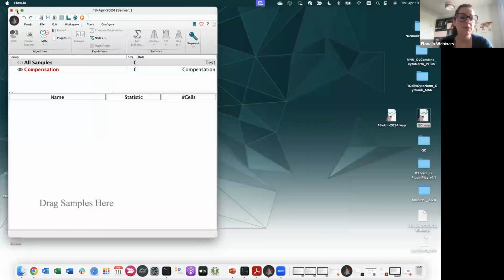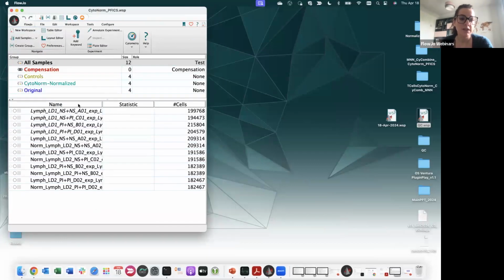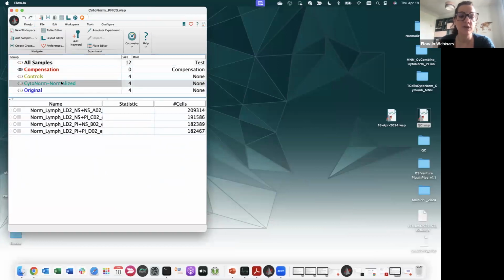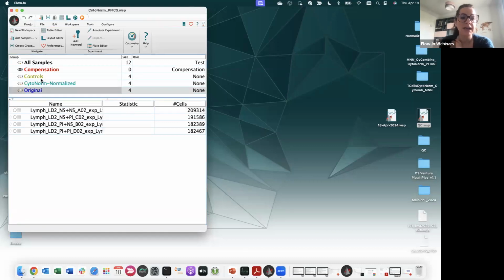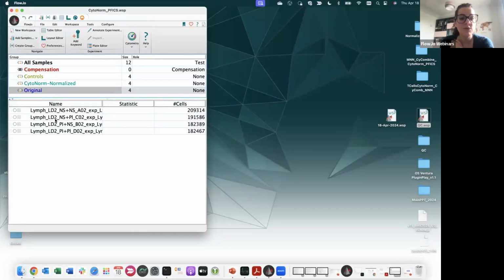And what you will be prompted with will be a new workspace. That should look like this one, kind of. You will have the Cytonorm normalized group, which will include your normalized samples. And you can define that by seeing this norm before the file name. And here I have my different groups. So I have my control group where I have my LD1 in 4 different batches because these are 4 different conditions, and my original ones that I want to normalize, 4 different batches as well.